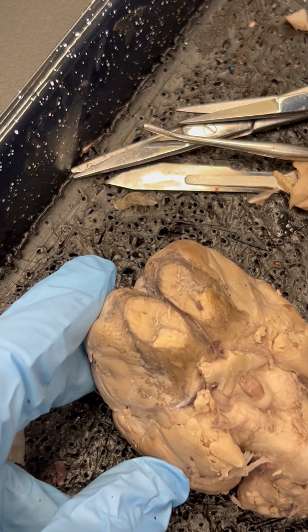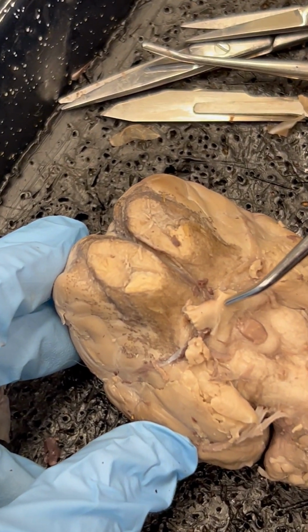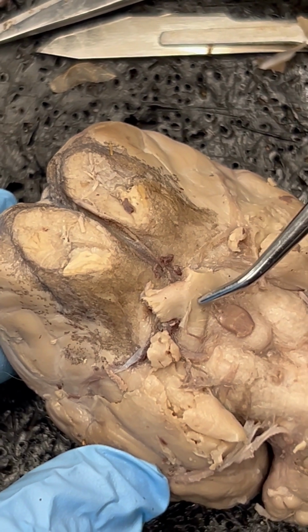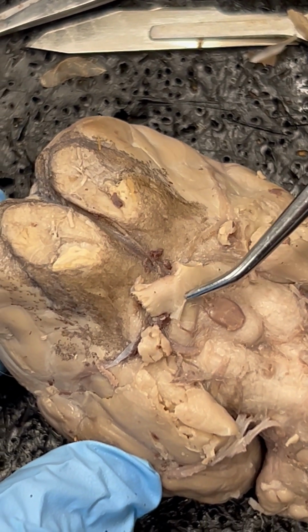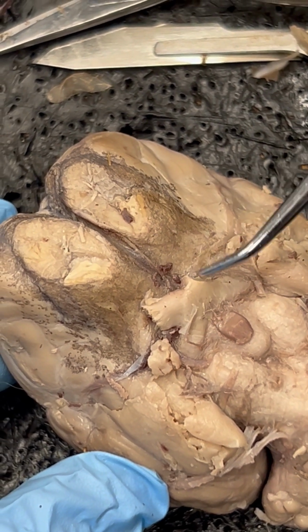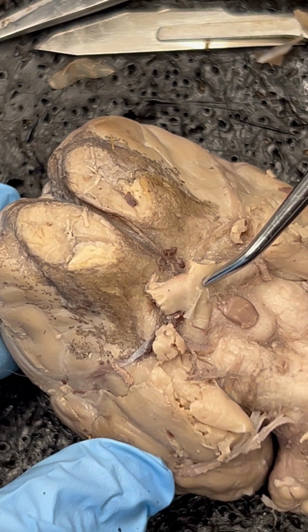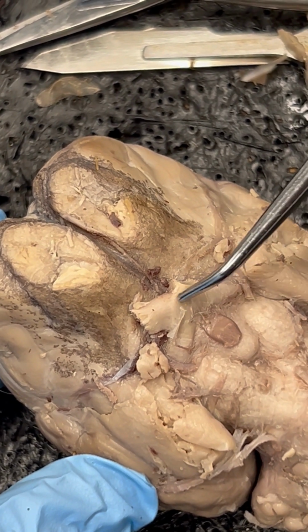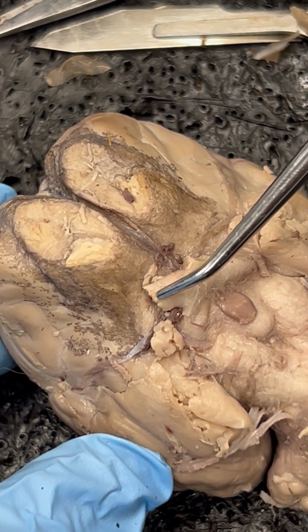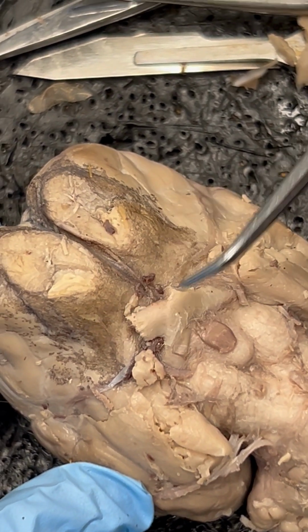Number 5 is the next term we need you to know, which is the optic chiasm. This is the central portion. And I'm going to jump to number 28 because I think it makes the most sense. The optic nerve comes off on either side. That's cranial nerve number 2, and it comes off the optic chiasm. So number 5, optic chiasm. Number 28, optic nerve. This side is more intact than this side, but they come off in both directions.